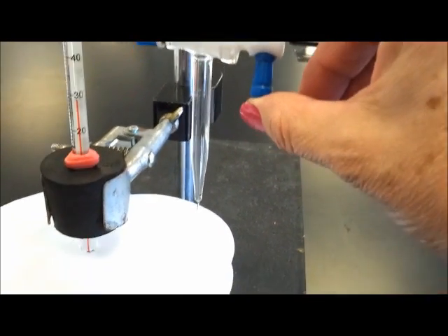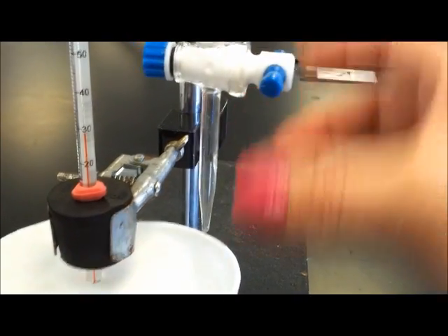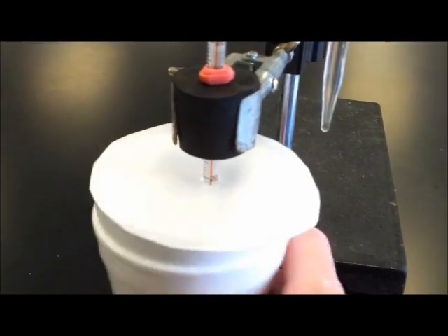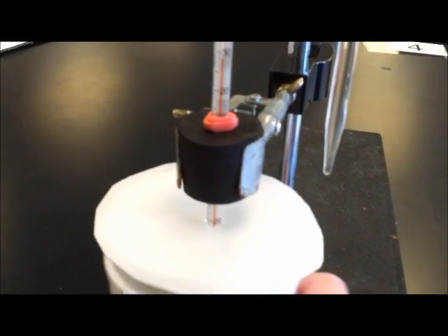Every single time we make a measurement, we need to record the maximum temperature and the actual reading in the burette. Don't make any calculations, just read.